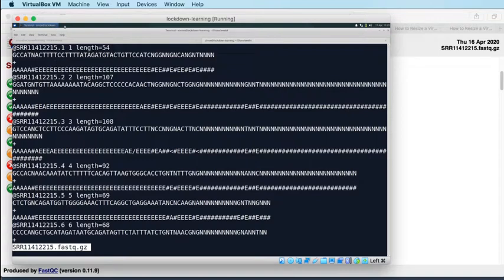So what we're seeing here, from the look of it, is we know that this is a NextSeq run. We know that from the metadata in the SRA and at GEO. You can actually tell at a glance as well that this must be a recent Illumina sequencing run, because even from this one page of data, the quality is only taking certain values. I can see maybe five different values for quality on this one page. I can see A's, E's, and hashes. That's 3. But I can also see less than characters and /. So I can see 5 different characters on here.